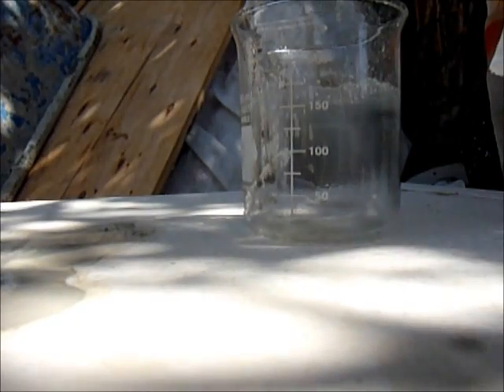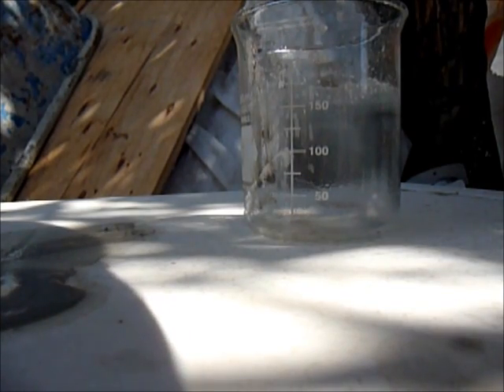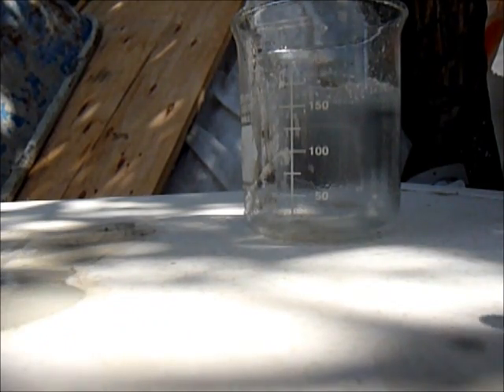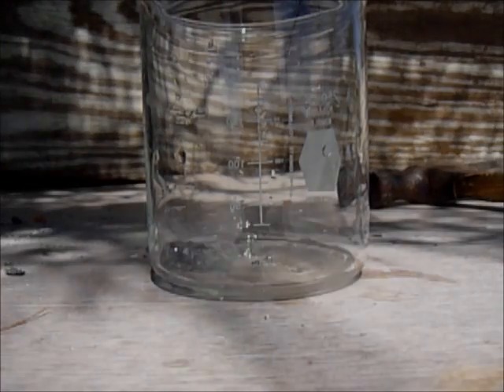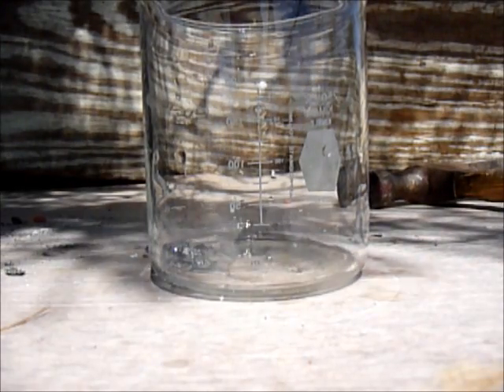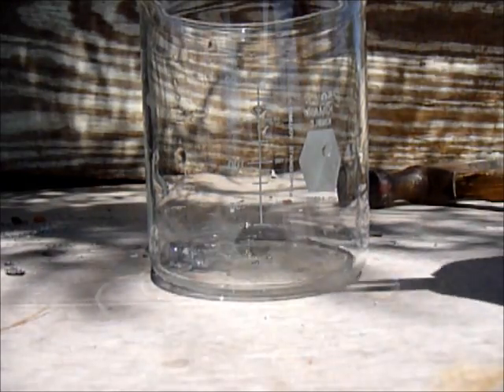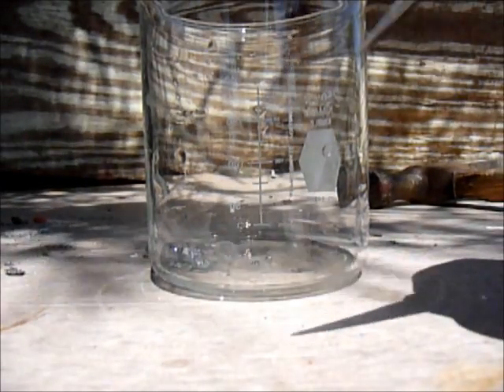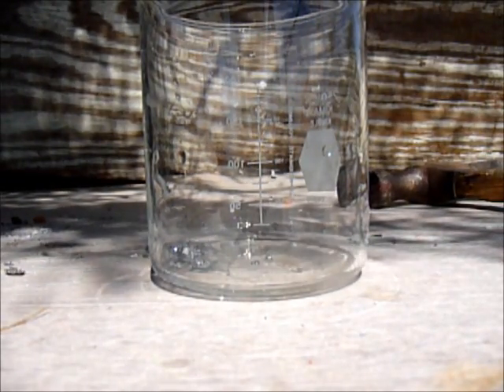You can actually see pieces of elemental silicon, big pieces. That's very cool. I don't have any more water so I'll come right back. After getting all the finished product with some tweezers, I got my elemental silicon.